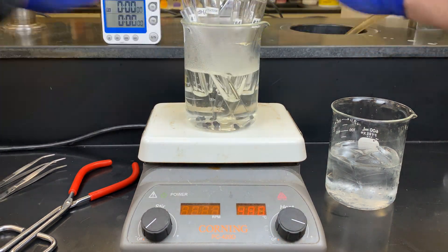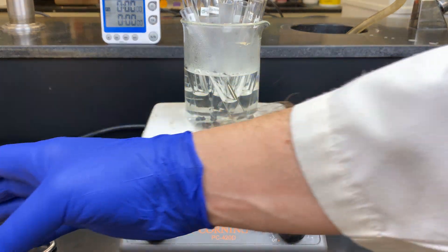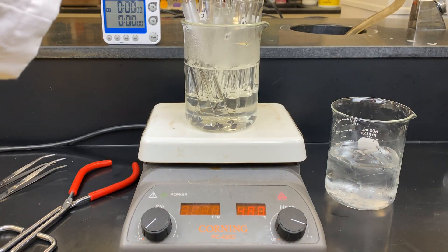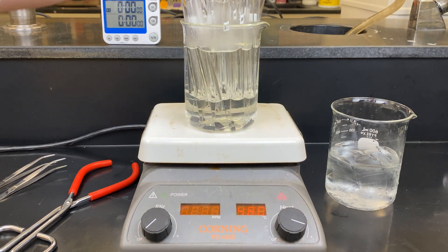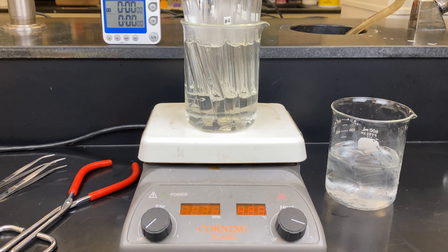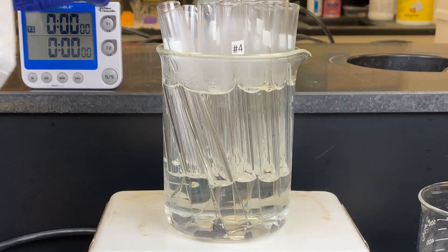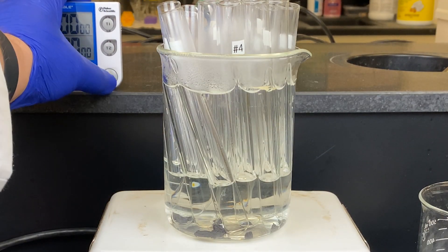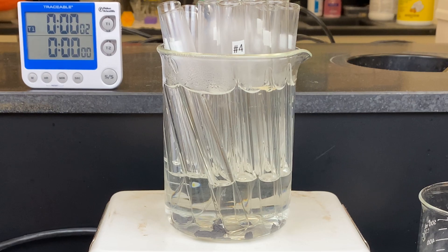We'll place the test tubes into the water bath. Try to get them all in at approximately the same time so they are heated for the same duration. We will now heat these for a total of five minutes.